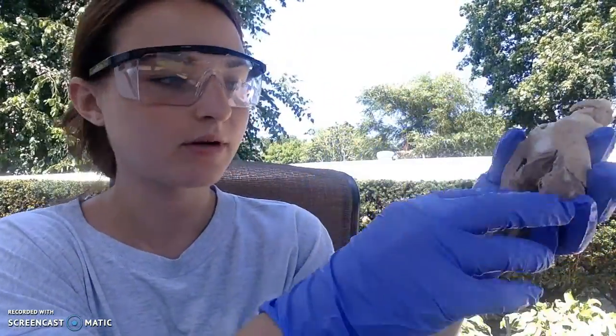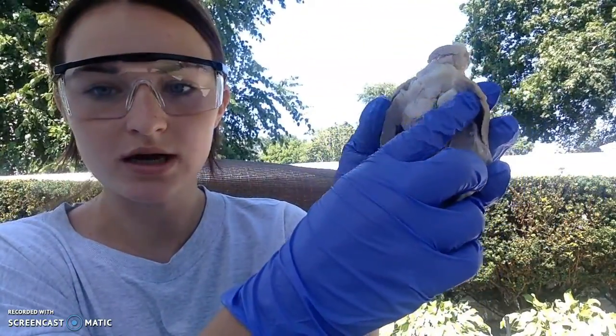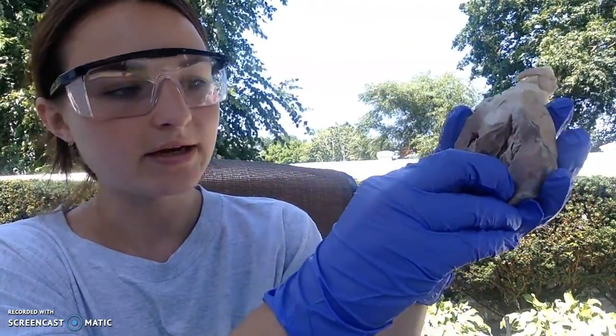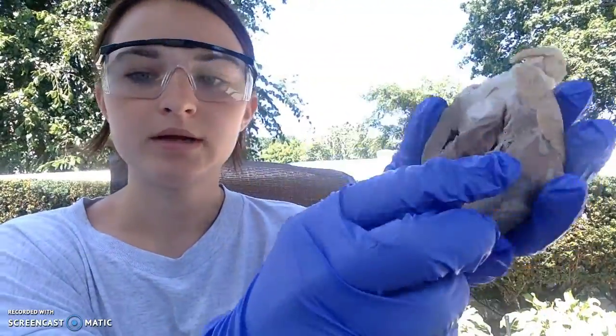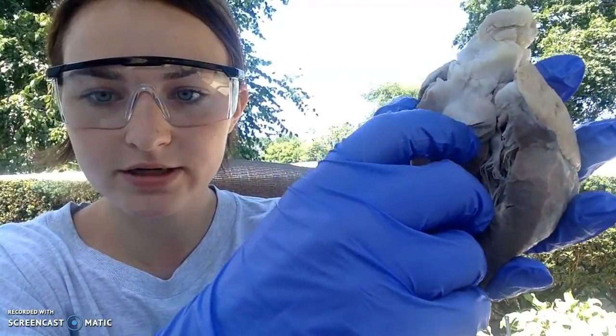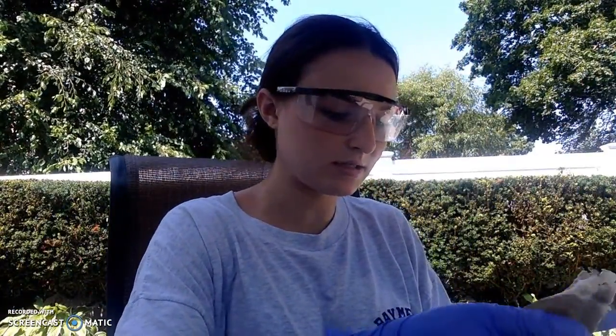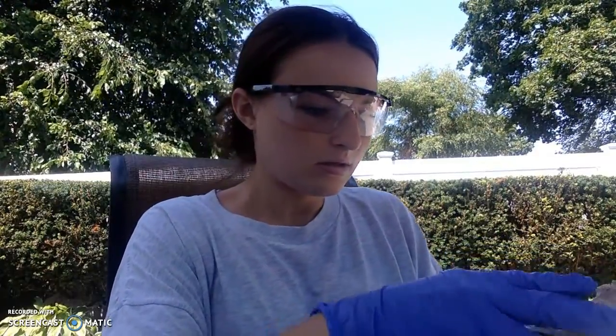On this side, it's a similar layout, except we have the left ventricle, which leads up into the left atrium, and then here we have the mitral valve, and it has the same chordae tendineae. On this portion, you can see the beginnings of the pulmonary arteries. So it's a little valve here. You can get a better look on these little sections here. We have the pulmonary artery here, so it goes up and out that way.